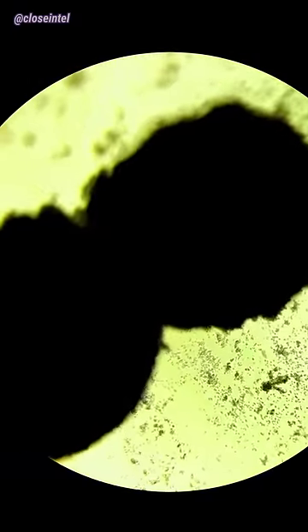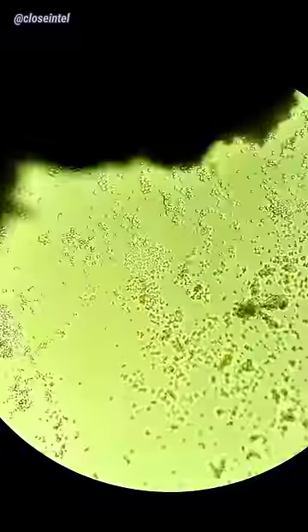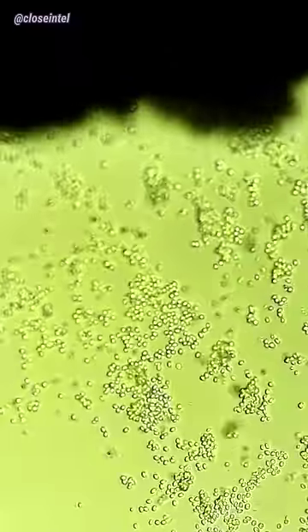You can tell when I added the hot water right here. It starts to expand immediately and the yeast begins to break off of the larger chunk. I added a coverslip so we could take a closer look at some of the yeast cells by themselves.